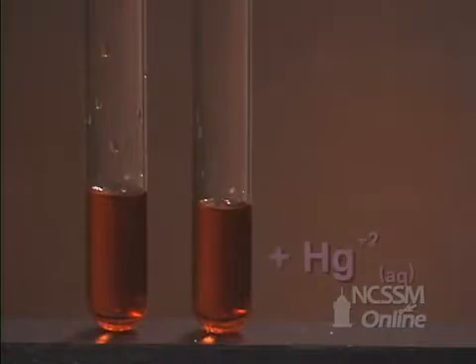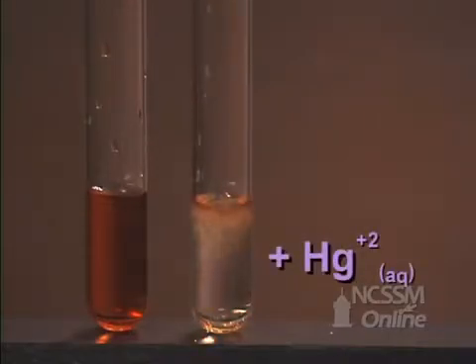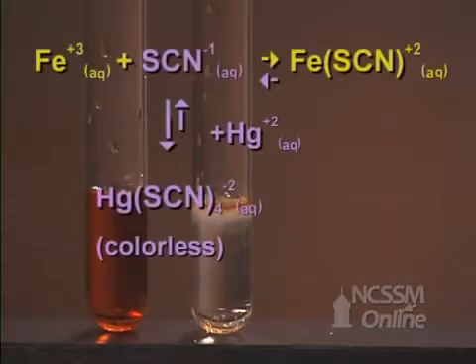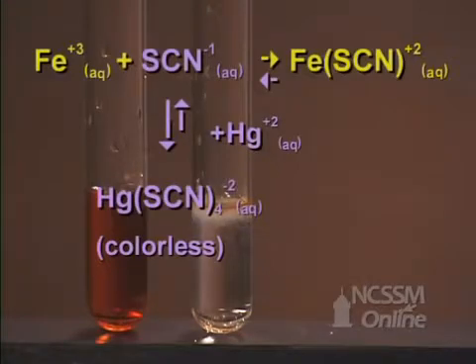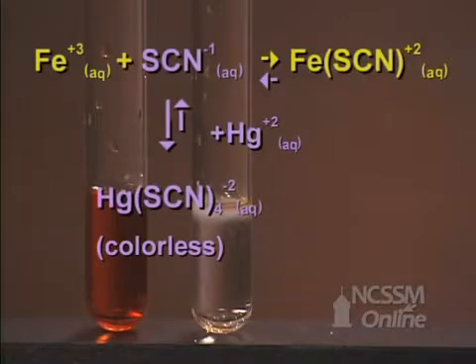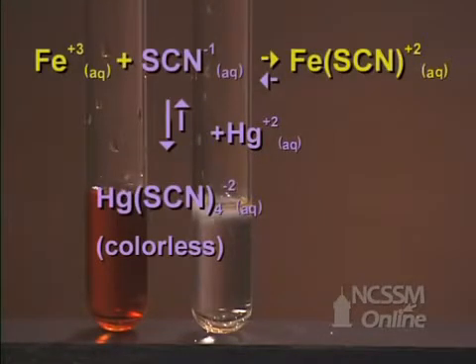We will now add some 0.1 molar mercury nitrate. The mercury(II) ion reacts with the thiocyanate ion to form a new complex ion. This effectively reduces the concentration of thiocyanate in the solution, and the equilibrium shifts in the reverse direction to try and replace the removed thiocyanate.